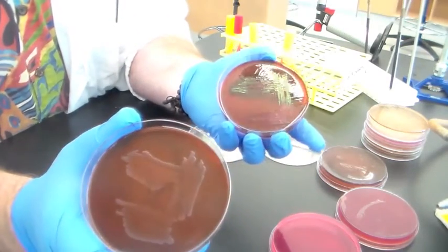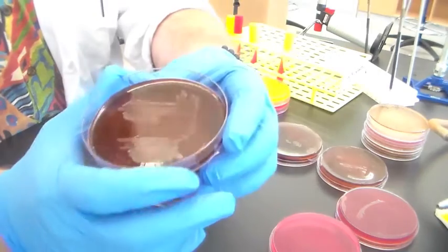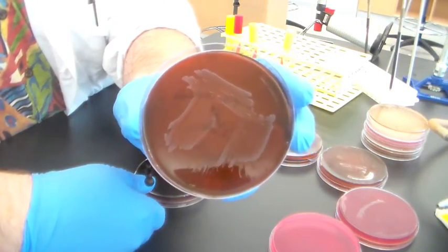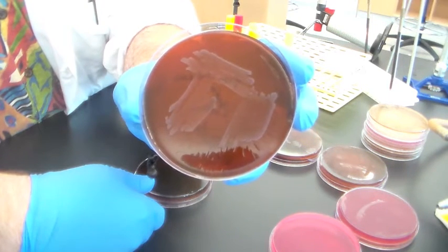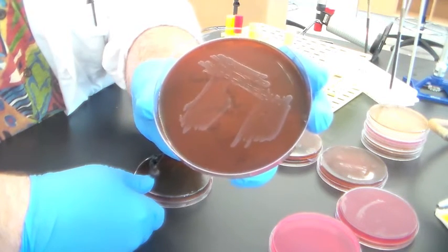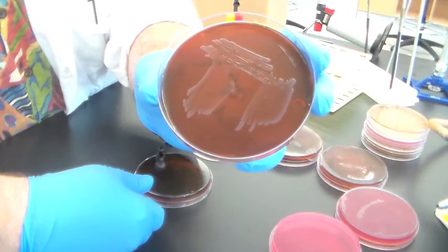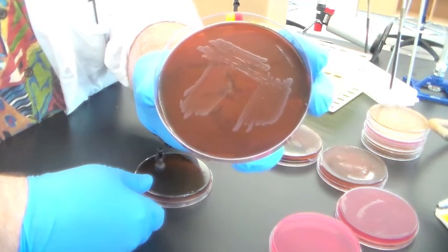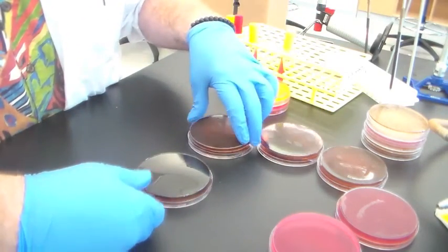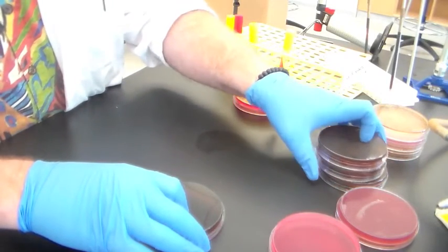Something like Salmonella, which is not capable of fermenting lactose or sucrose, will still grow on this media because it's a gram-negative bacterium — it's not inhibited by the methylene blue. But because it can't ferment lactose, it's not causing the eosin pH indicator to turn black, so you get clear colonies. Compare that to what the plate looked like to begin with.